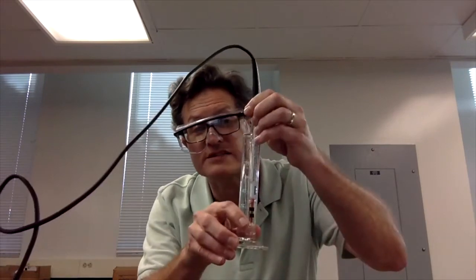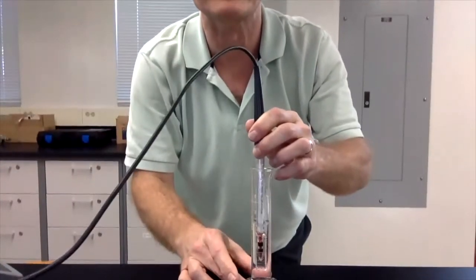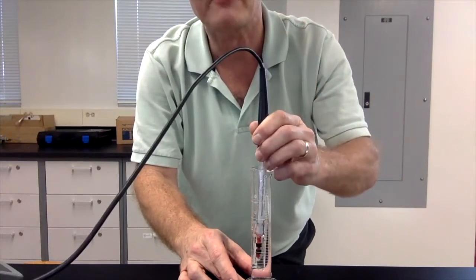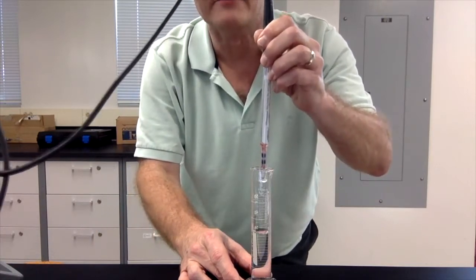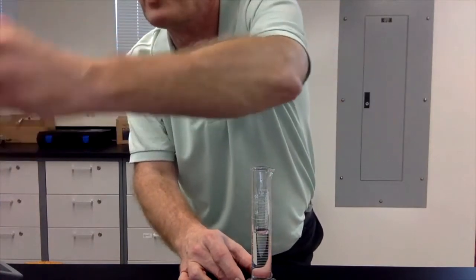So when we're using one solution, we get that totally submerged like that. We don't need to rinse in between these measurements. We're going to make 5 measurements so that we've got several in there. And we're going to note those all down.